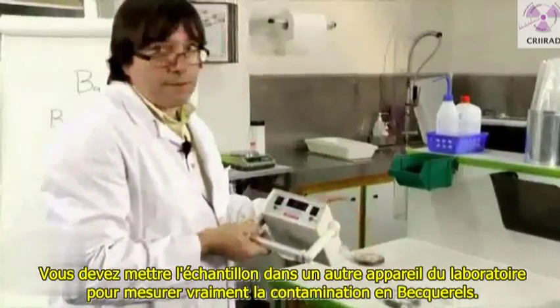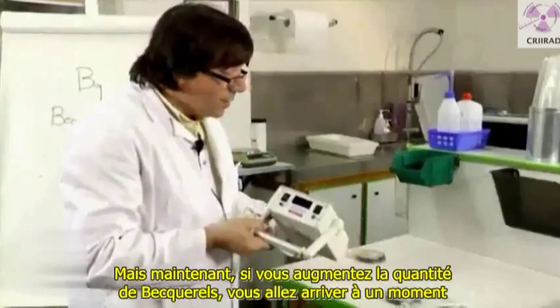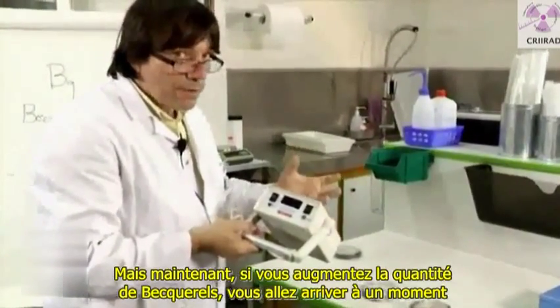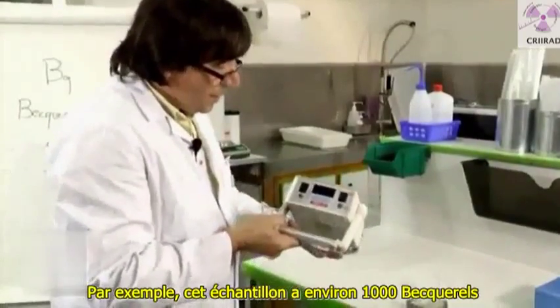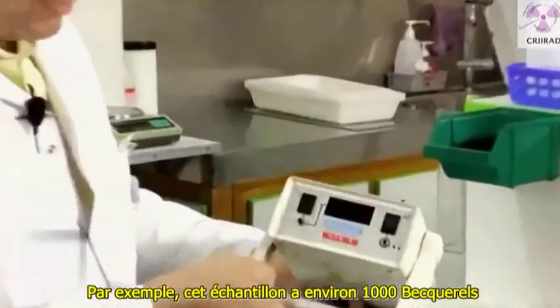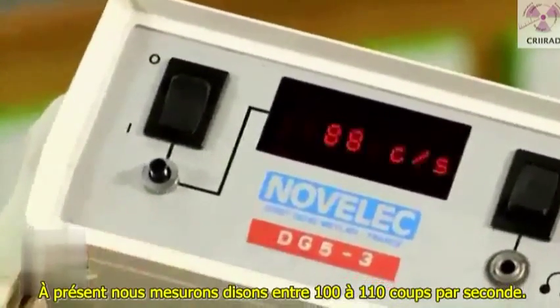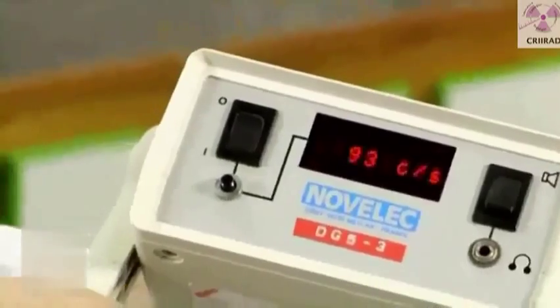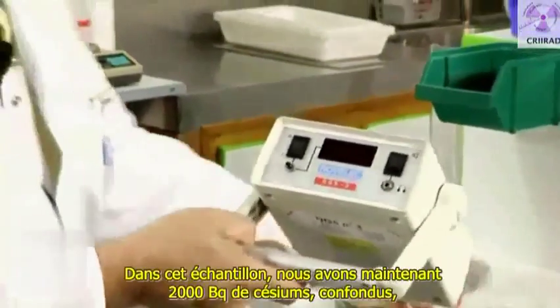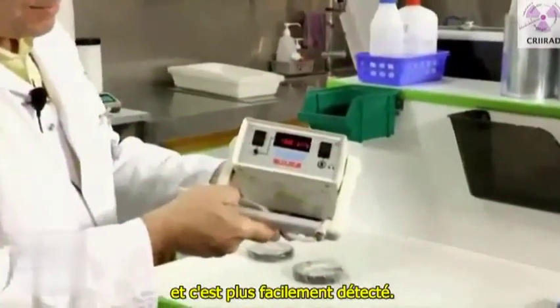You need to put the sample in a device in the laboratory to really measure the contamination in Becquerel. But if you increase the amount of Becquerel, you will reach a point where it increases the gamma radiation around the sample. For example, this sample has about 1,000 Becquerel, and it is slightly increasing background radiation — about 30%. We now measure between 100 and 110 counts per second. In this next sample, we have 2,000 Becquerel of cesium, and it is more easily detected.